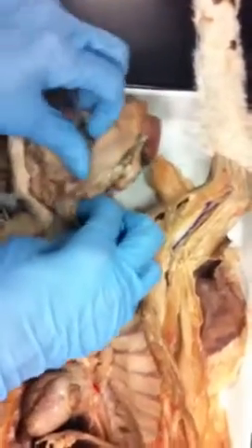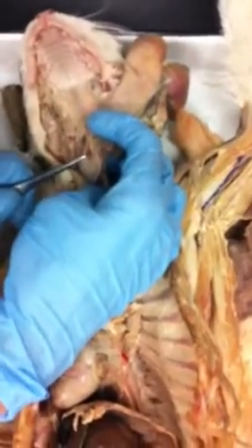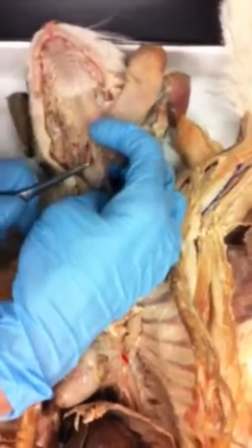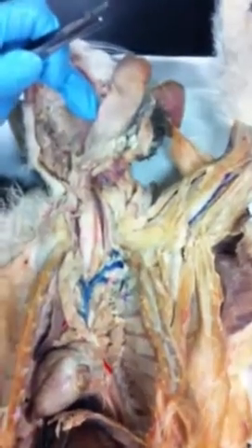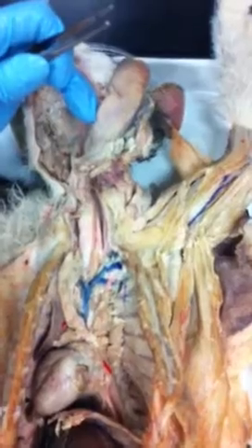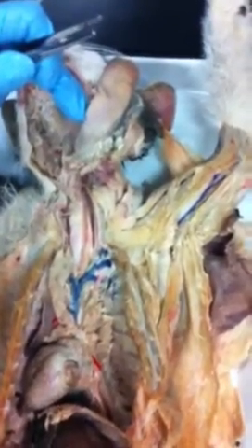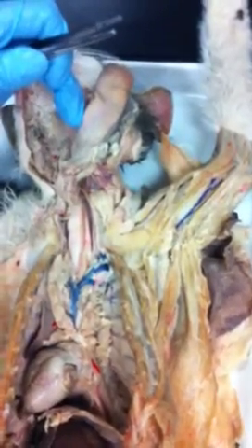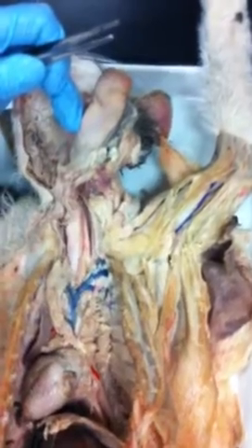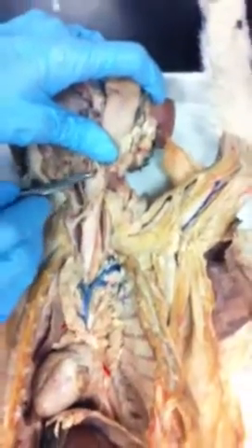You can also see in here, if you look closely, these right here. These are the arytenoid cartilages. Can you turn that around? Yep. Those are the arytenoid cartilages right there. And those are attached to the vocal folds in there. So if you squeeze those, then you move the vocal cords. Like that. So again, these are the arytenoid cartilages right here, these hard things right there in the cat.